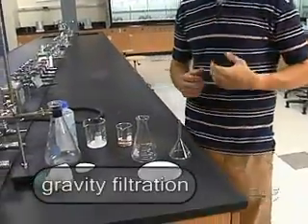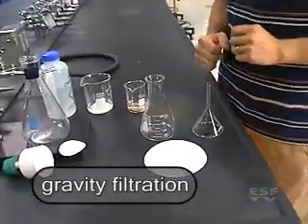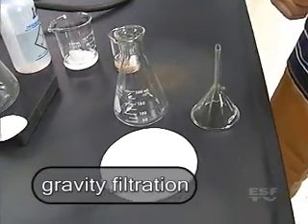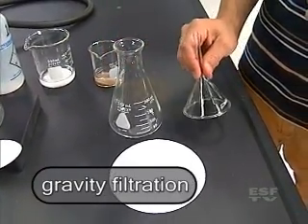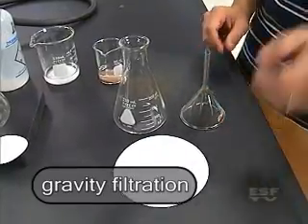Now in gravity filtration we're going to use just what the name implies, gravity, and there's only a few pieces of equipment we need. First we need a flask, a funnel, and a piece of filter paper.